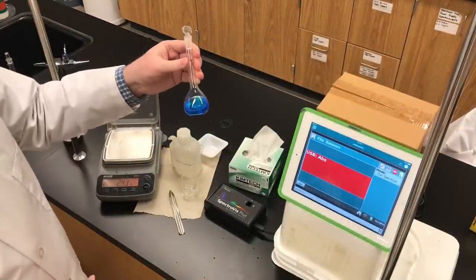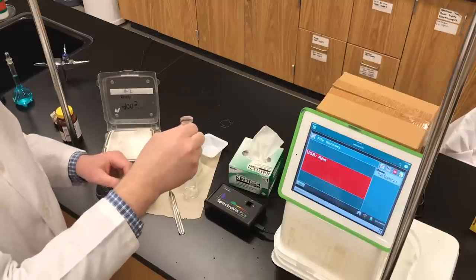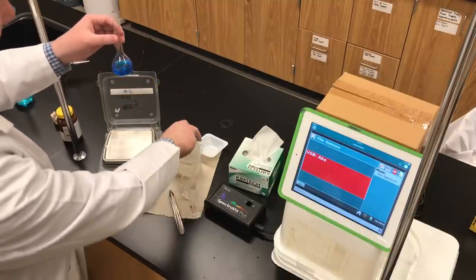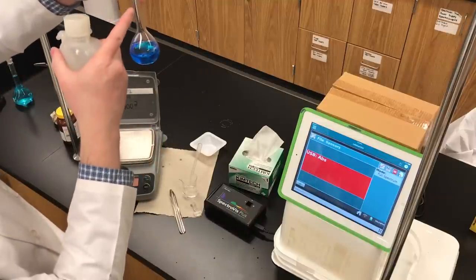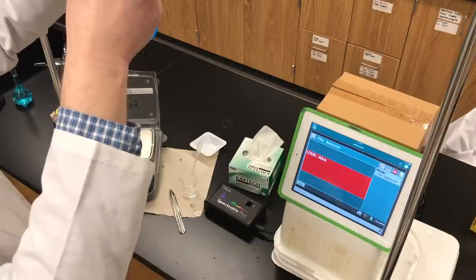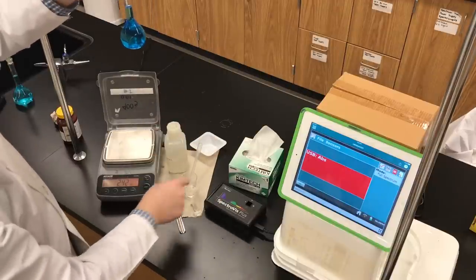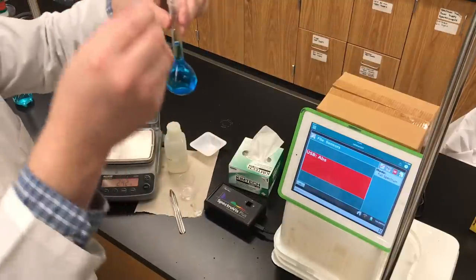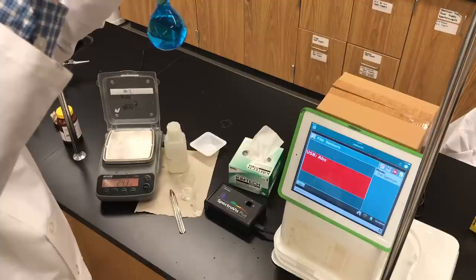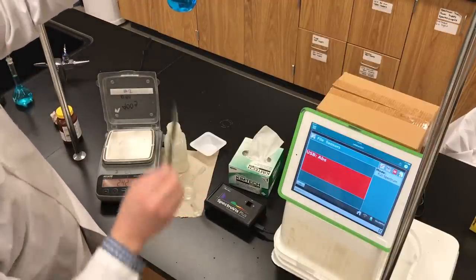After about a minute of shaking, the salt is completely dissolved. It's a nitrate salt — copper-2-nitrate — and nitrate salts are highly soluble in water, though they may not always dissolve quickly. Now I'm going to remove the stopper and add more distilled water. On a volumetric flask there's one line on the neck that I'm trying to get the meniscus to. I'll add water drop by drop with a plastic pipette, looking at eye level, until the meniscus just touches the line.